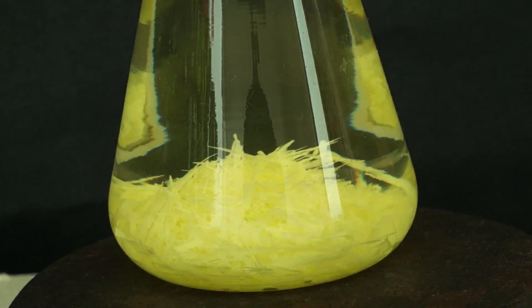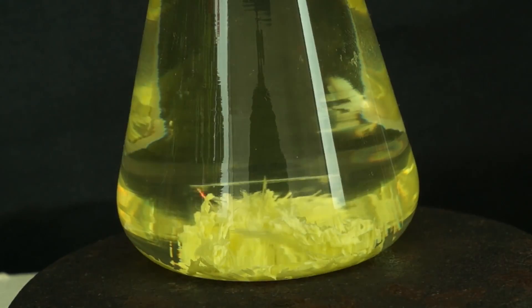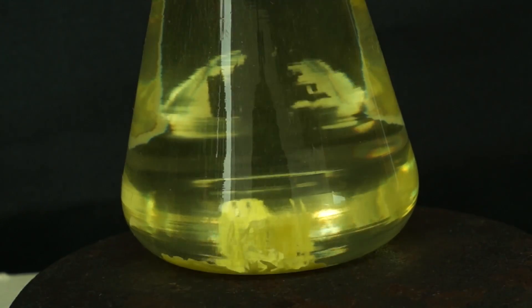If the mixture is heated again, the crystals will dissolve and the experiment can be repeated one more time.